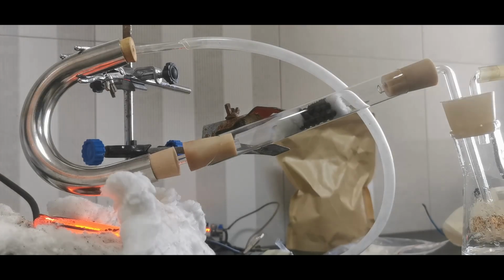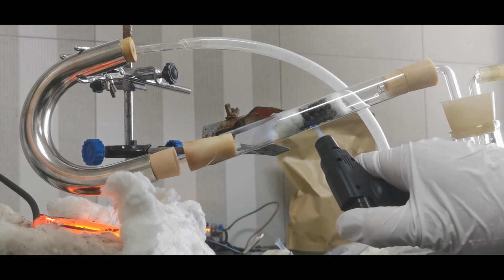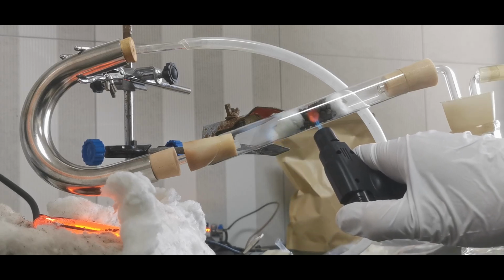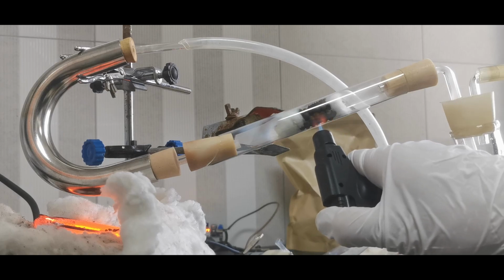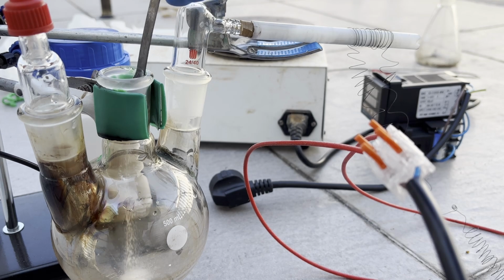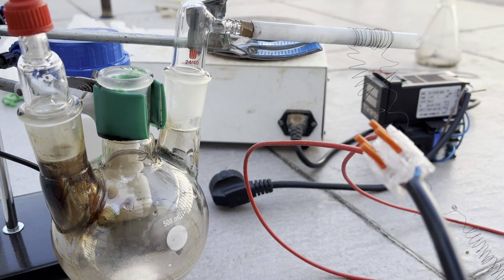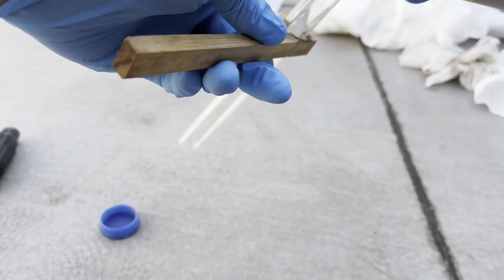After a few more failures trying to burn sulfur to obtain sulfur dioxide, I realized that the combustion is too unreliable to start and run, and generates a ton of sulfur vapor along the sulfur dioxide stream, which was extremely annoying. So, for my next design, I switched to generating sulfur dioxide from sodium metabisulfite and sulfuric acid. The downside of this is that we're consuming an equal amount of sulfuric acid as we may be generating, so we cannot produce sulfuric acid from this. But since I also wanted to make some sulfur trioxide, I thought that this is also okay.